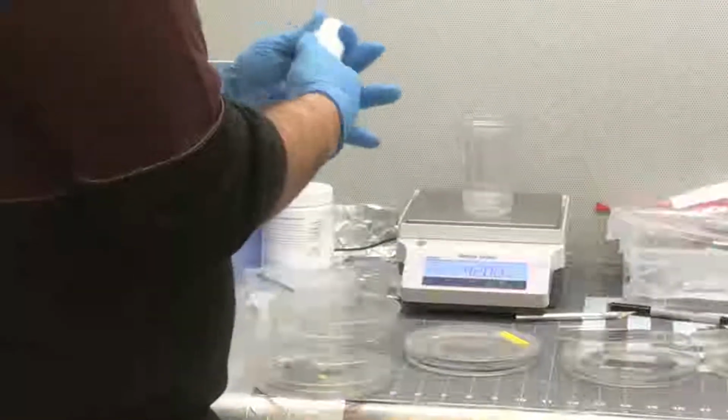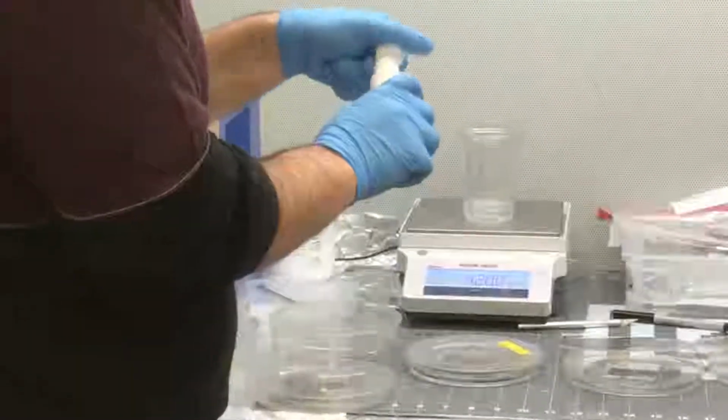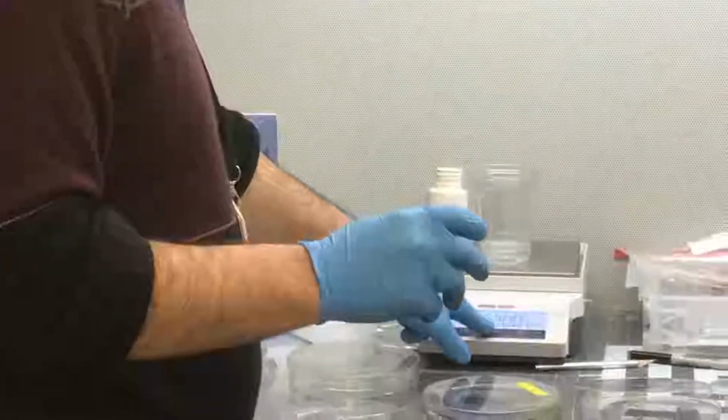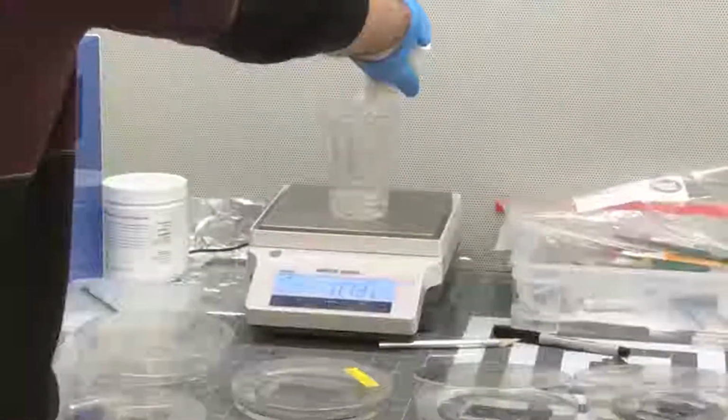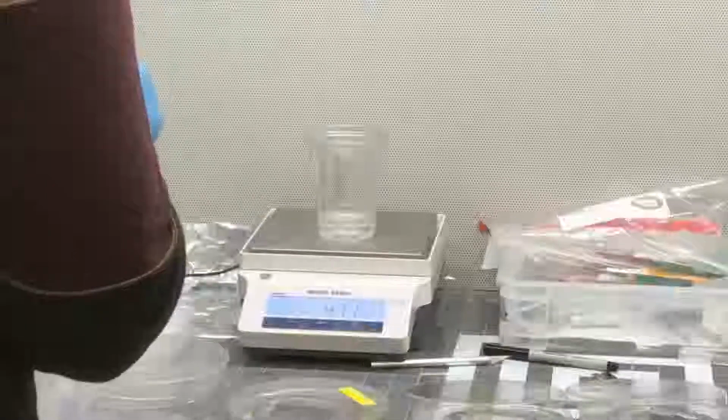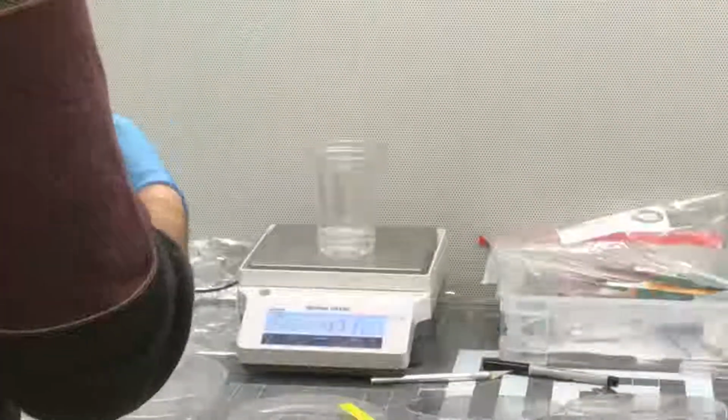So for this chip, we use 10:1. You are making it for pH. For pH, yes. For this one, we will add 4.2 gram of the curing agent. Now it's a little bit more, but it doesn't matter. More curing agent is fine, less is not good.